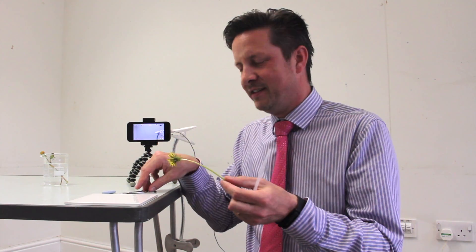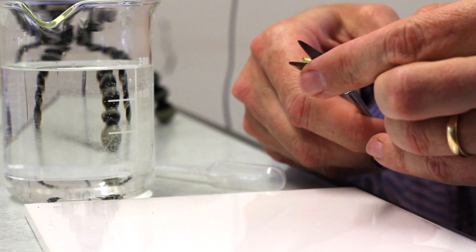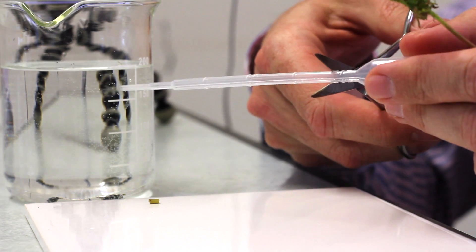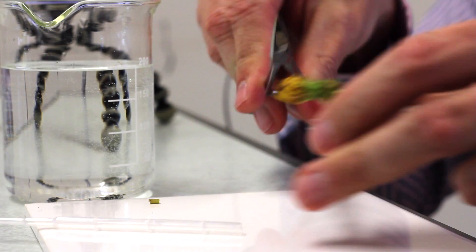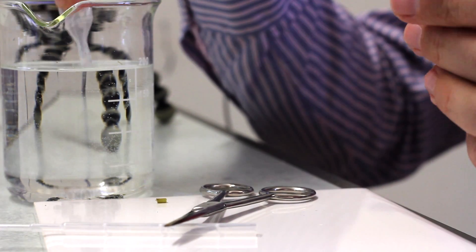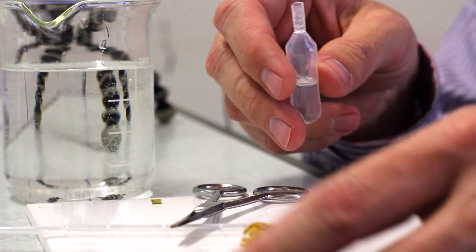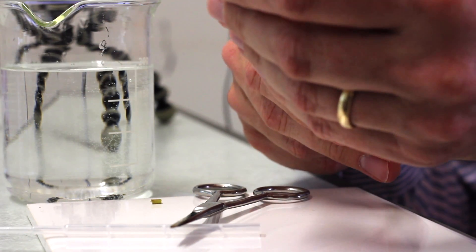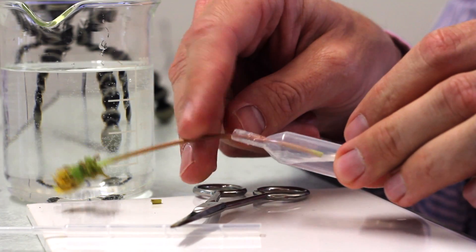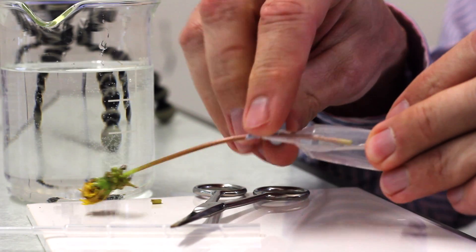So we take our dandelion and just make sure we've got a nice fresh end to this so we can get some water ingress. Take a pipette. I'm going to remove the thin end of the pipette so that I can insert the dandelion stem. I need to fill this with a little bit of water, then insert our dandelion stem into the pipette just so that it doesn't dry out.